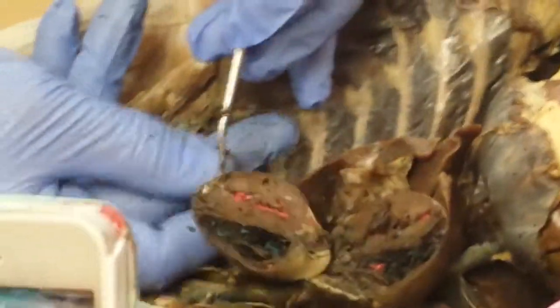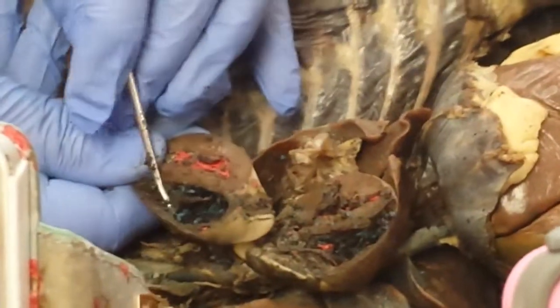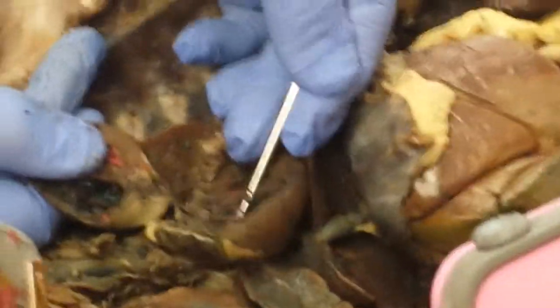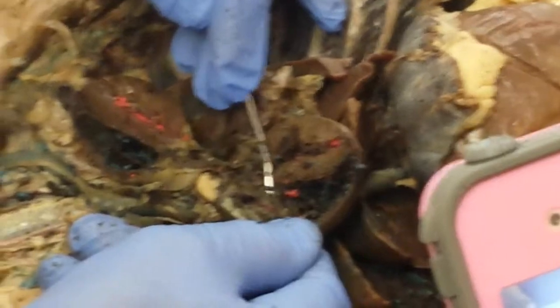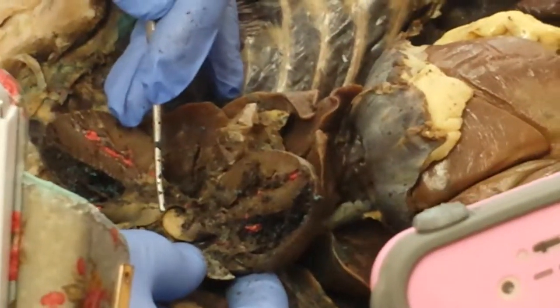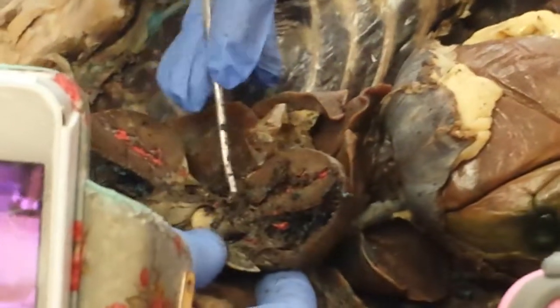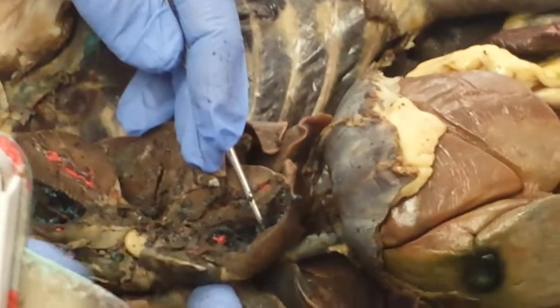The papillary muscles are these sort of church spire-looking muscles. They're not very obvious in this section, but they have sort of a church spire or tent-like appearance. That's why they're called papillary muscles. What's the purpose of papillary muscles and the chordae tendineae? To hold the valves in place so that when the ventricles contract, they do not prolapse and we do not have backwash of blood. Alright, so from the right ventricle, where does the blood go next?